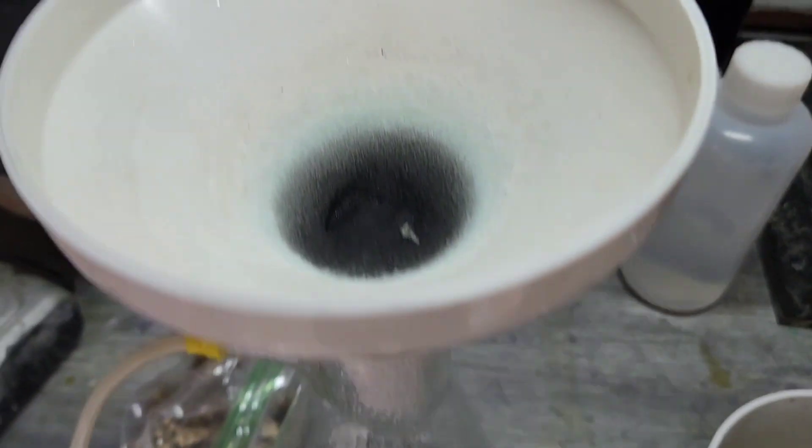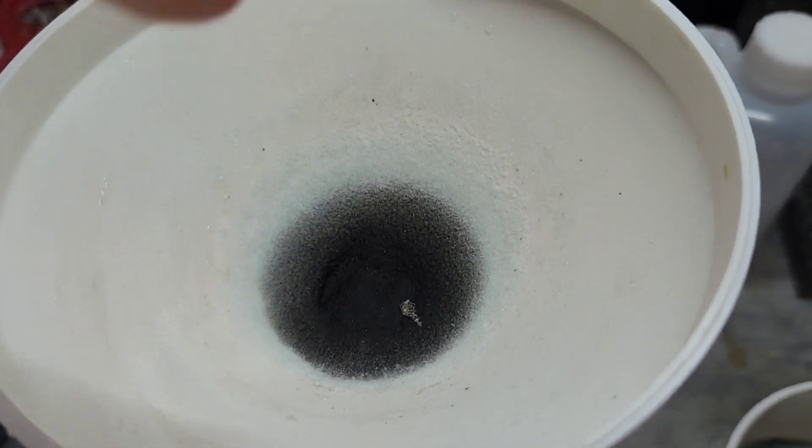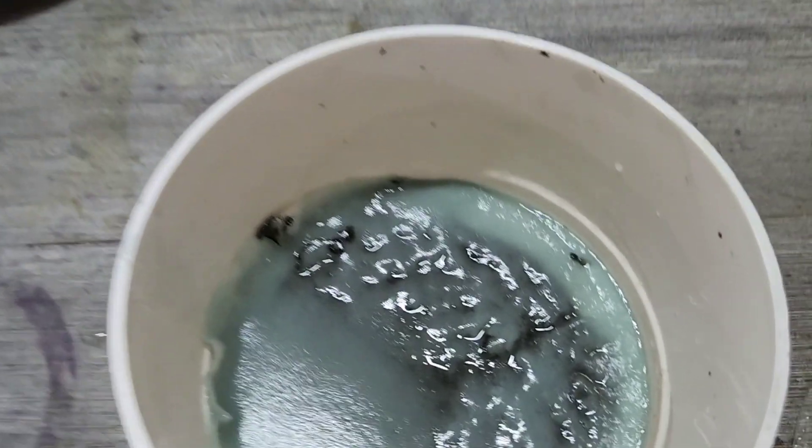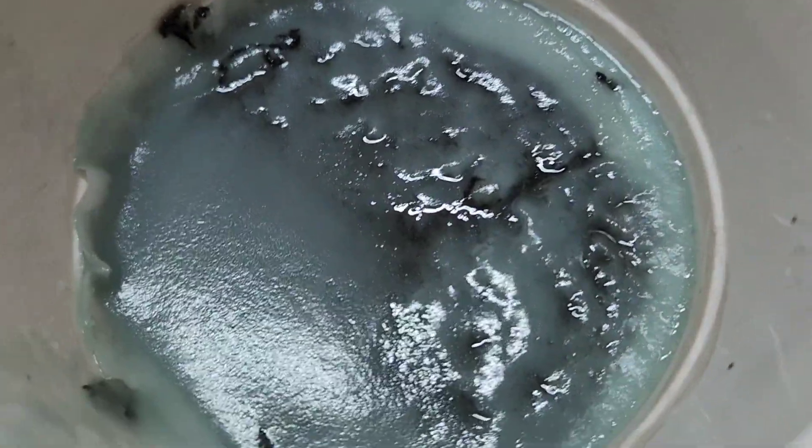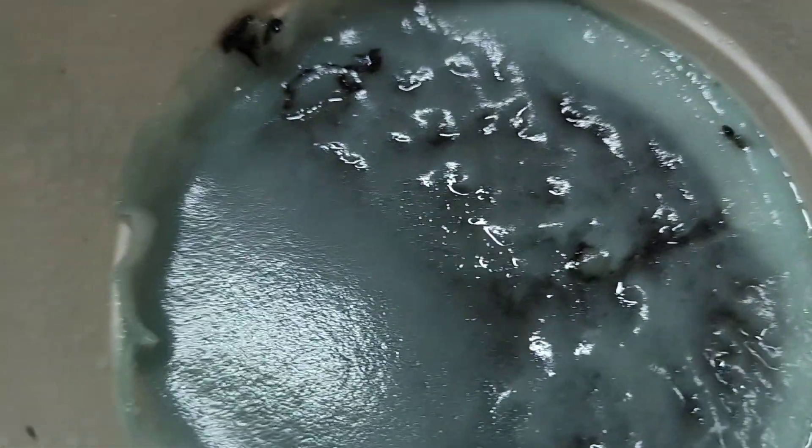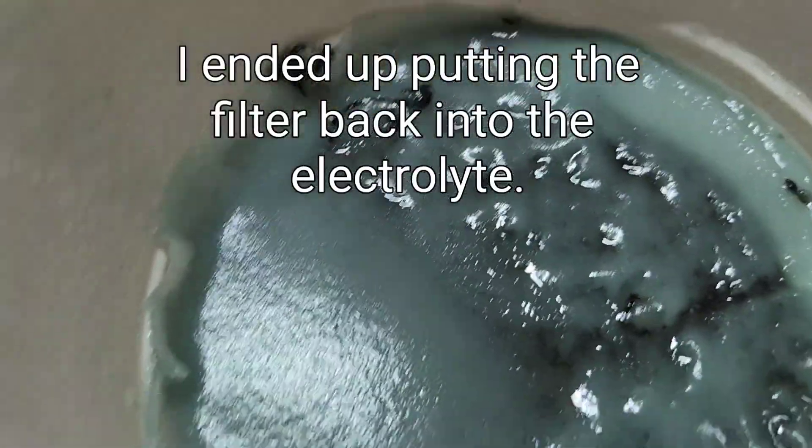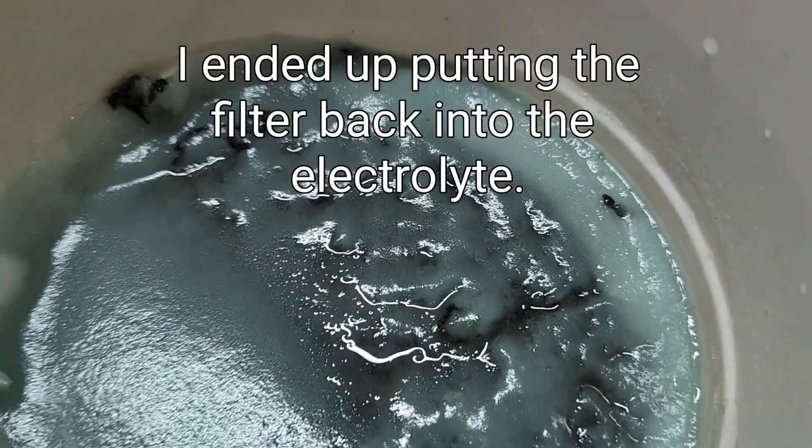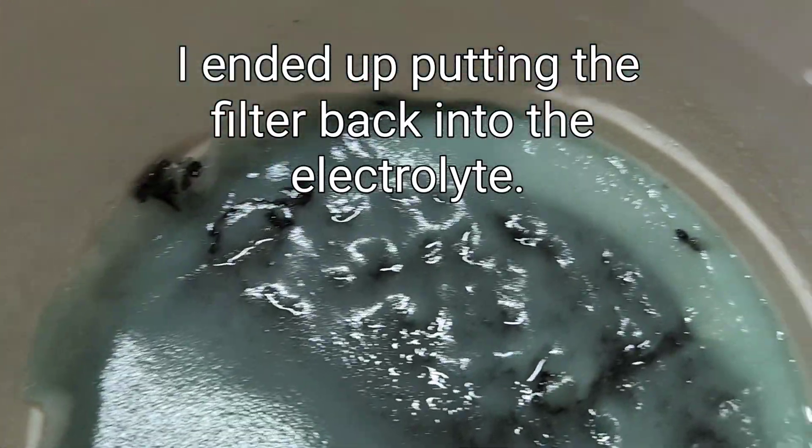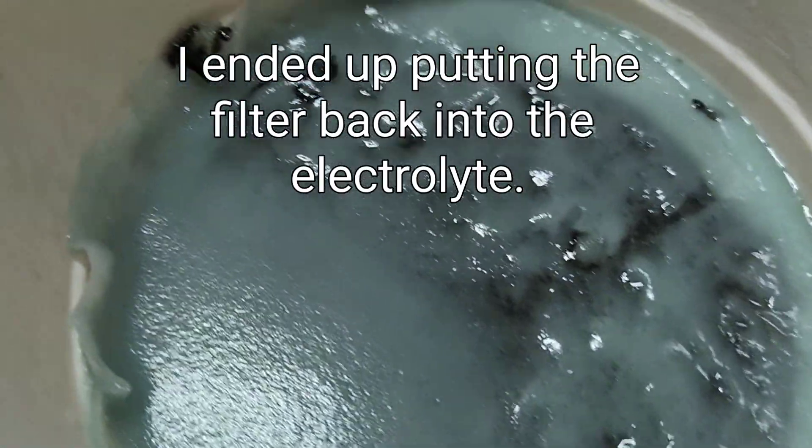All right, so I ended up having to switch. I put three cotton balls in there to plug it up because the crystallization on the filter was just happening so fast. Look at that, blocking it right up. So those are all good crystals. We'll be able to get those. I'll have to use some distilled water to absorb them and then basically evaporate them out.